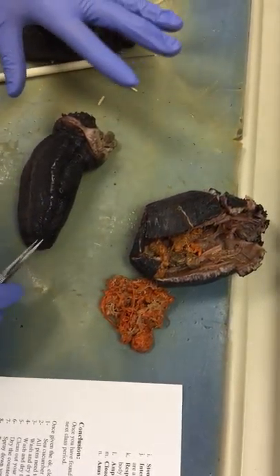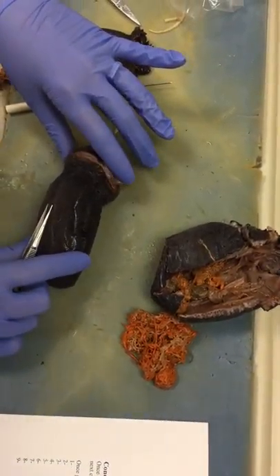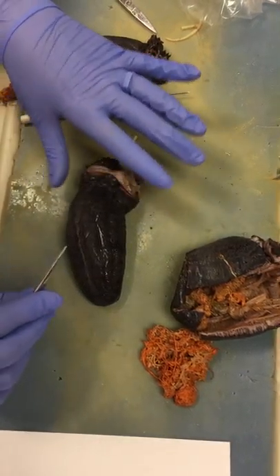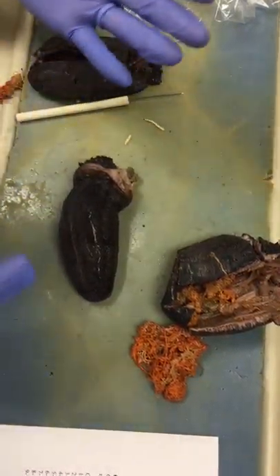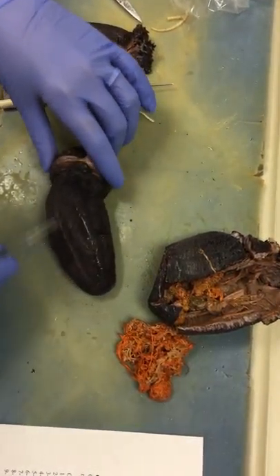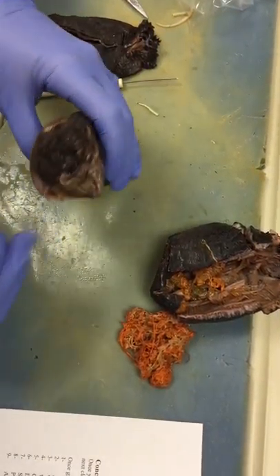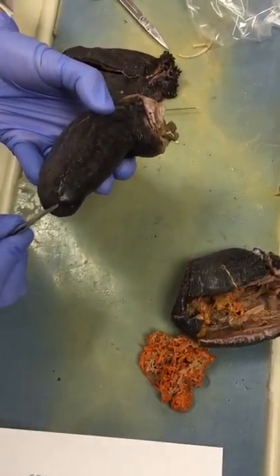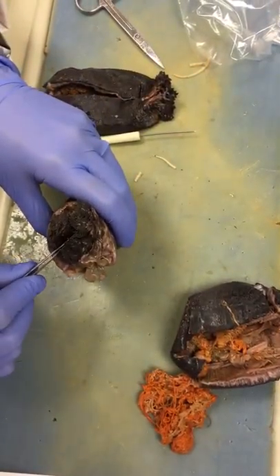What we're looking at is a sea cucumber, in class Holothuroidea. 'Holo' means like a zoophyte, so a zoo plant or an animal plant. What we're looking at is the outside, and this area is going to be the oral region, and this is the aboral region — so lacking a mouth, and with the mouth.